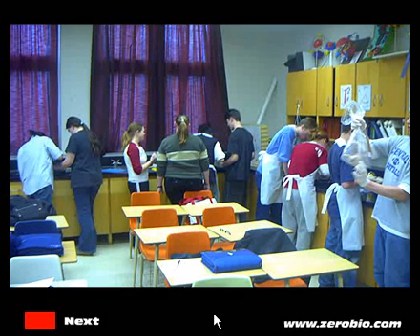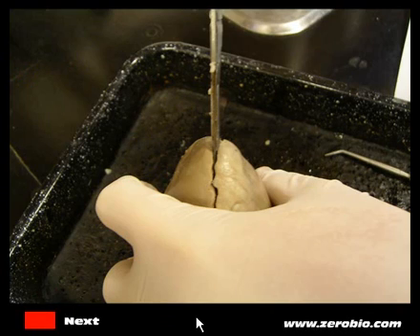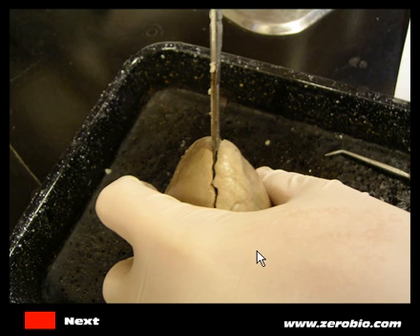Here's the class getting into the dissection. This actually looks like a fetal pig dissection — there's the bag the fetal pigs often come in — but as you can see the students are wearing their nice trendy plastic aprons as well. So let's get into the actual parts of the heart. Once you get your heart, you're going to place it into a dissection tray and do most of your examination there. You'll also be wearing gloves.